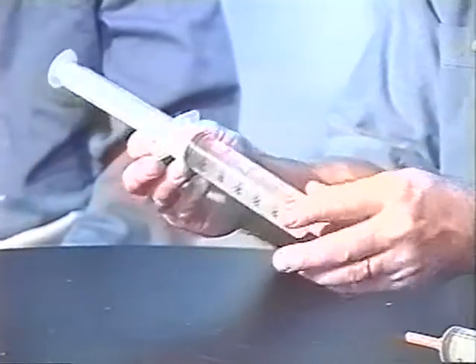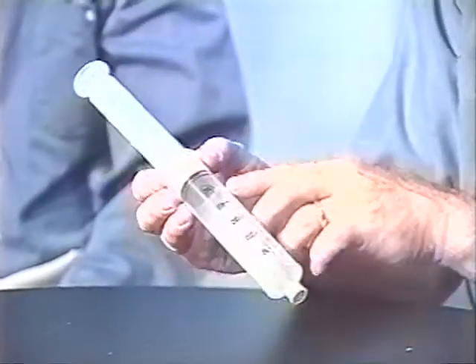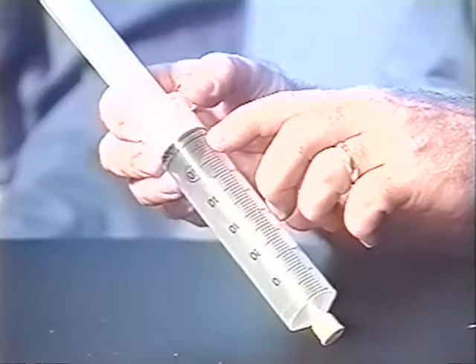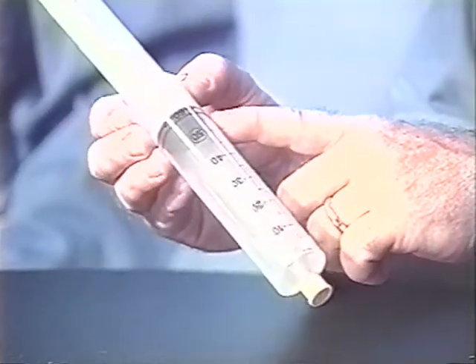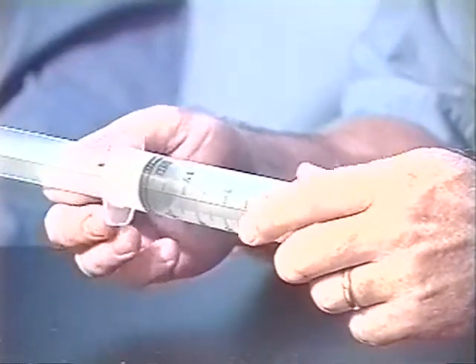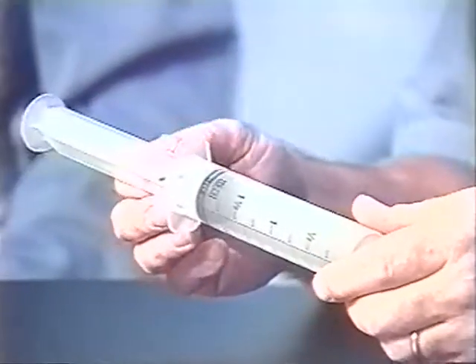So we know the mass of the gas and the volume of the gas. In order to determine the volume, you want to read from the bottom of the diaphragm, just where the rubber starts. You can read that to at least two significant figures, probably three. You also need the barometric pressure and the temperature that day, and very nice results can be determined using this method.